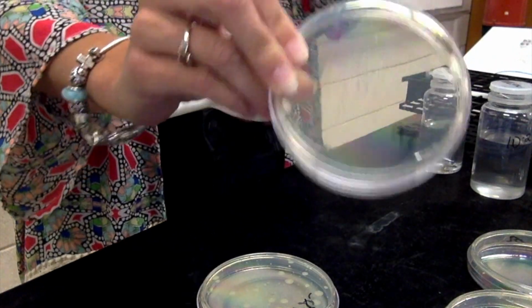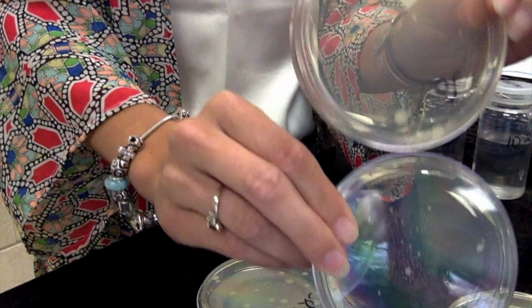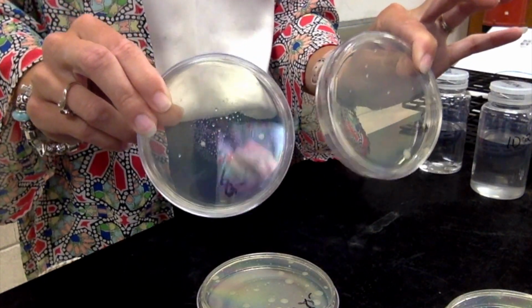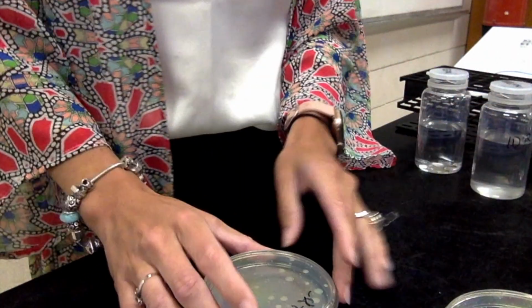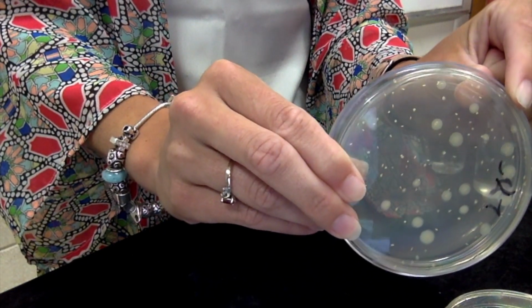So I only have about 11 CFUs on my 10 to the negative 8s. Here's both my 10 to the negative 8s. They both look the same. There's not enough colonies on here for me to count, so I'm going to eliminate these. So not my 10 to the negative 8. But my 10 to the negative 7, nice, even, and that looks like that's got about in between 25 and 250 CFUs.